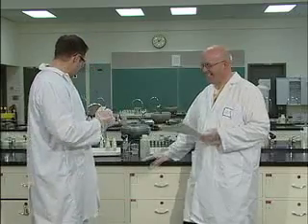All right, any safety precautions today? Definitely. Need to be wearing gloves, and need to be wearing eyewear, of course, as usual. All right. Very well done.